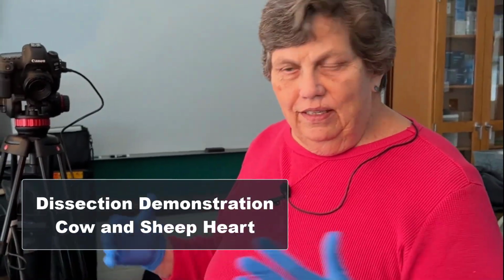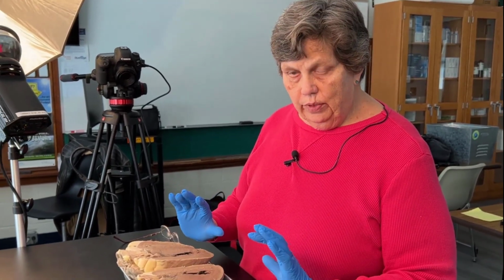Welcome to the laboratory. Since you guys are online, we decided to give you a little bit of laboratory experience. I know you've been going through models in AP1 and that sort of thing, but in AP2 we do dissection. So I wanted to bring you into the lab and actually do a couple dissections with you. Okay? So the first one we're going to start with is the heart.